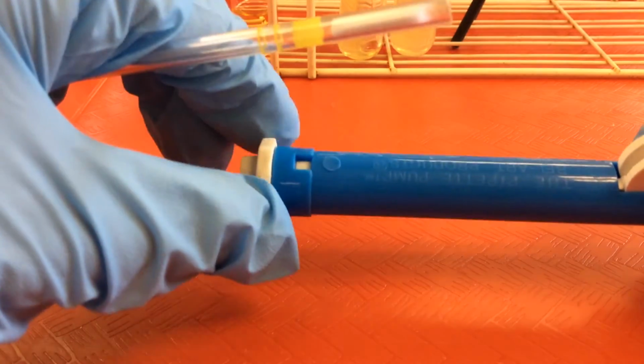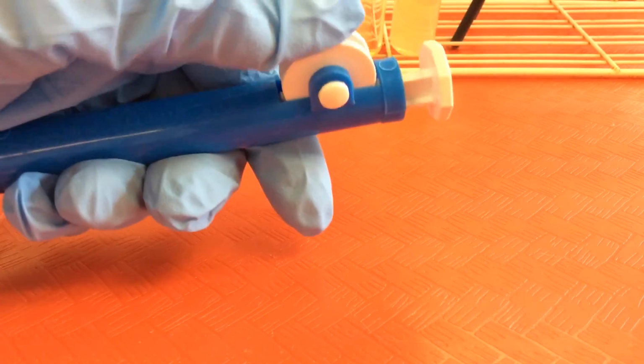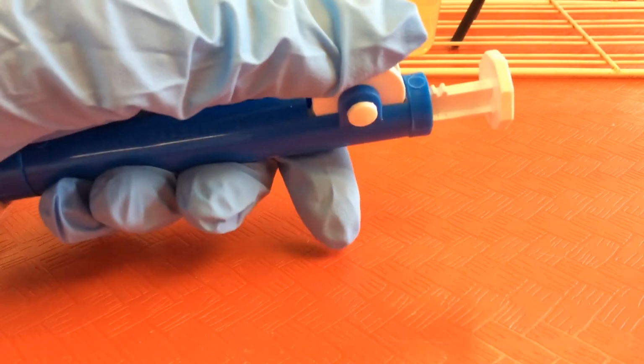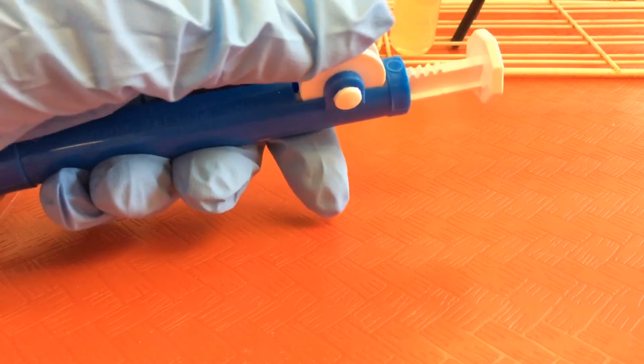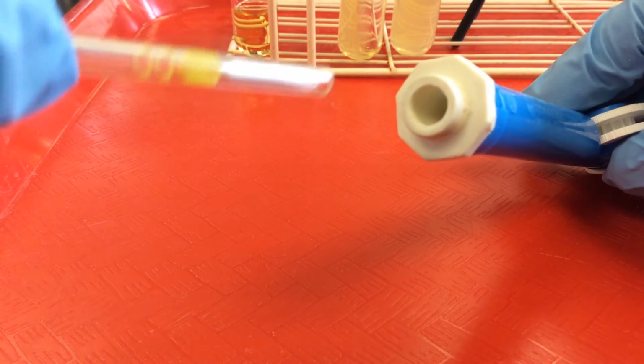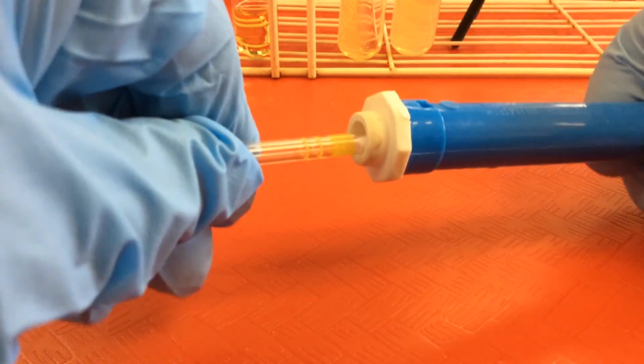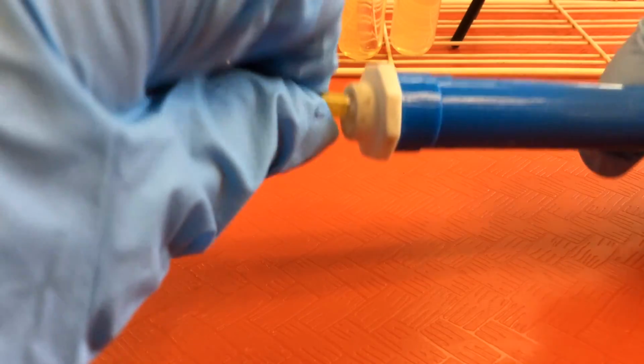So here we have a smaller pipette pump, and we'll see that there's a knob here that if we rotate, you'll see that the little plunger is moving. So that's how we're going to create a vacuum. The opposite end is the end into which we'll put the blunt end of our serological pipette. So we want to place it and gently twist with a little bit of pressure. We want to make sure that we have a good seal.